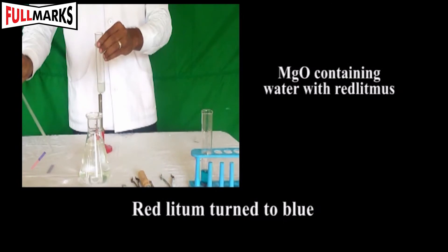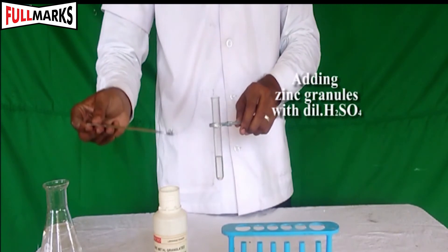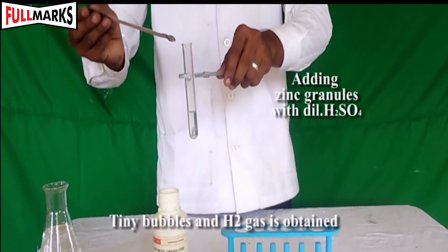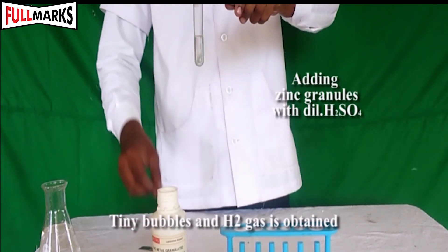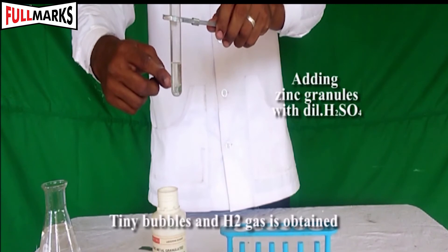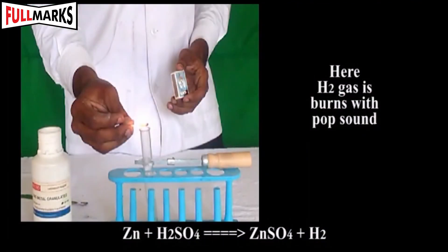Magnesium hydroxide is basic in nature. Procedure 3: Take 5 ml of dilute H2SO4 solution in a test tube and add a zinc granule to it. Test the hydrogen gas produced by bringing a burning matchstick near the mouth of the test tube — hydrogen gas burns with a pop sound.